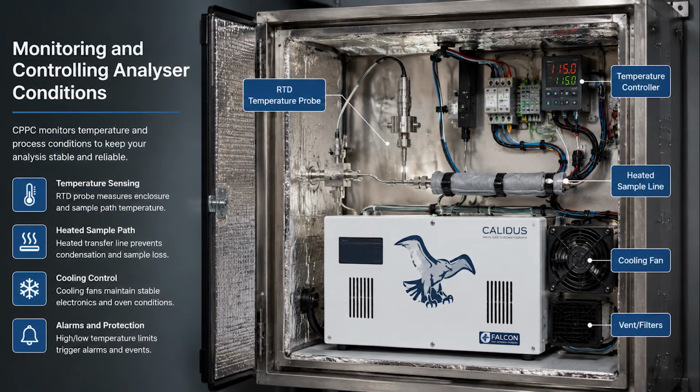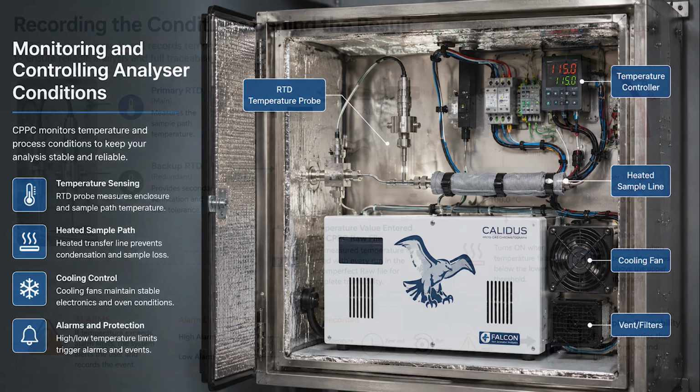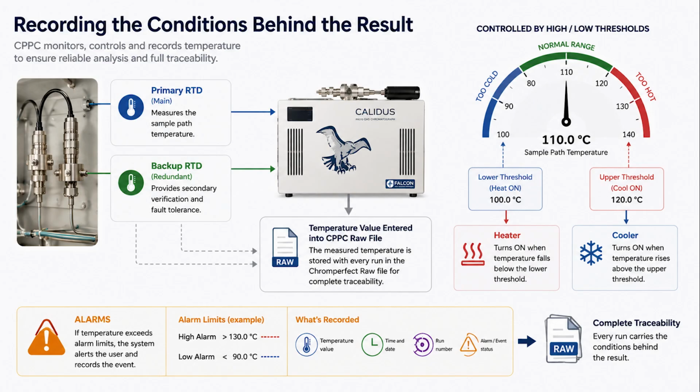Temperature sensing and control can also form part of the system. CPPC can read a main temperature sensor and, where configured, a backup sensor. Temperature readings can be recorded inside the Chromperfect raw file as user fields, creating a direct record of the conditions associated with the analysis. The system can also operate heating or cooling outputs according to configured thresholds.